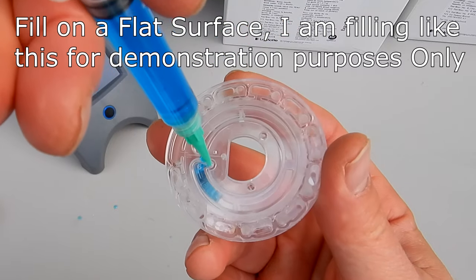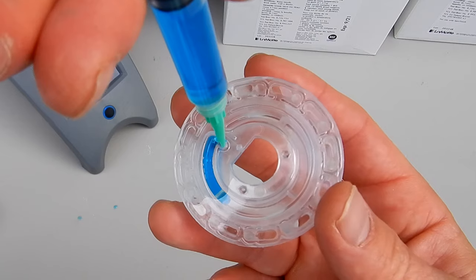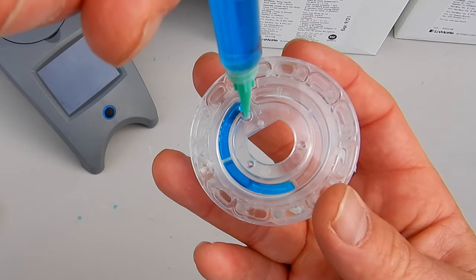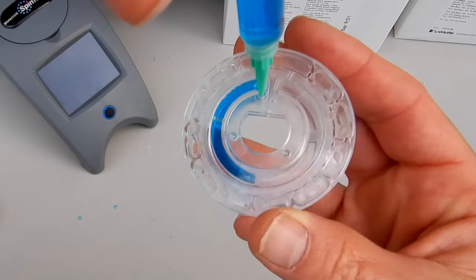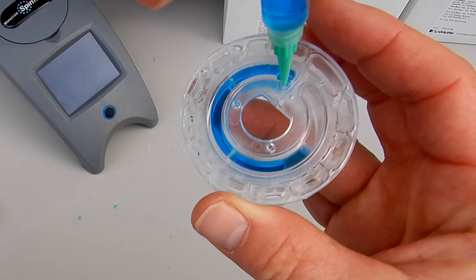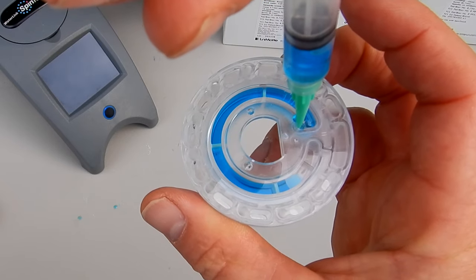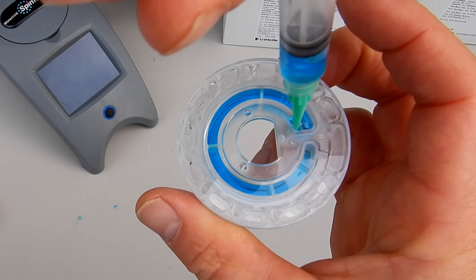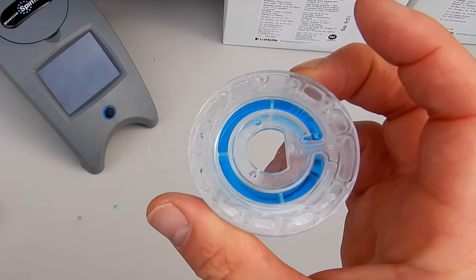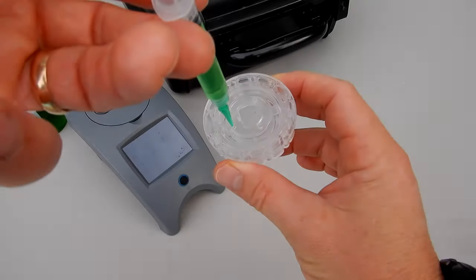You can see how it gets a little bit darker — there's water on the bottom and there's water on the top of the chamber. The water is on the bottom and now it's filling the top, getting close to the fill line. You can see it on the bottom, and as I push down more it's going to fill to the top. I'm going to stop right at the line — that's how you get an accurate reading using the disc.